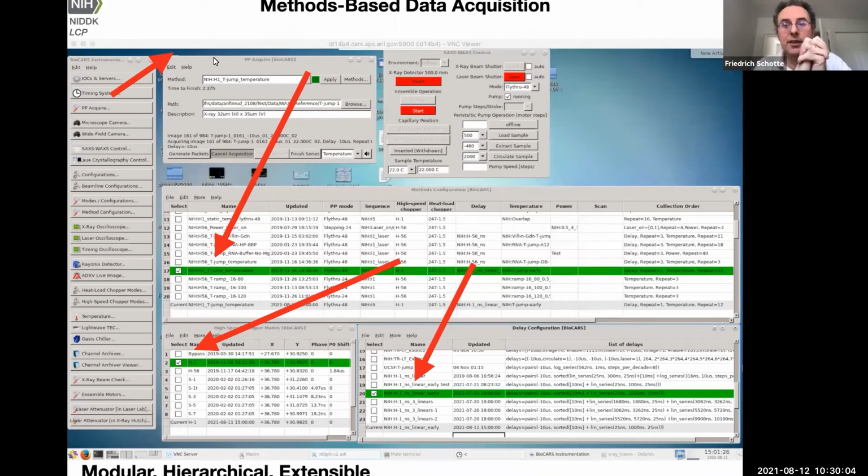So the idea, actually Philip's idea of how to organize things, is to have a big database where all that is stored, organized in the form of tables, which correspond to previous data collections we did. They are saved with parameters in that table, so you can recall them, say the next one or 1 hour later, to exactly reproduce the data set with all its parameters. So there's no manual typing in parameters. You can just do it at 3 a.m. in the night, after 24 hours of no sleep, and it still works.